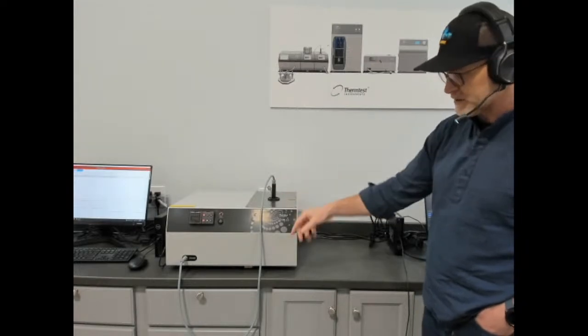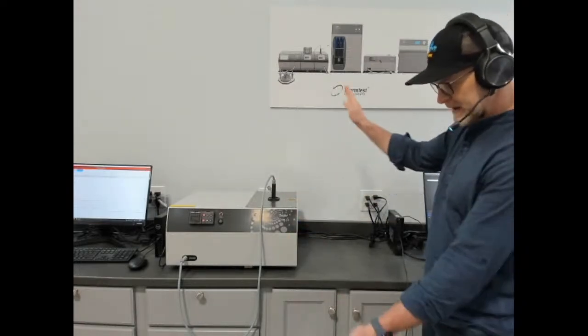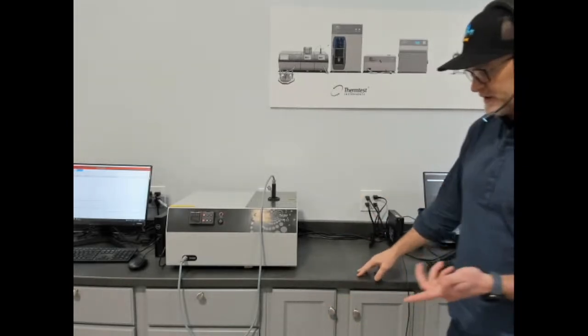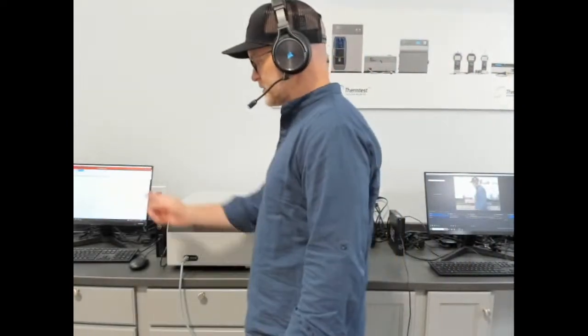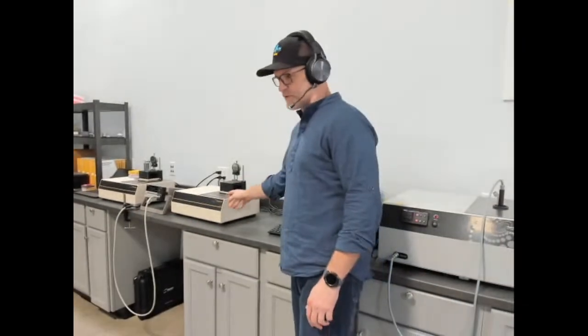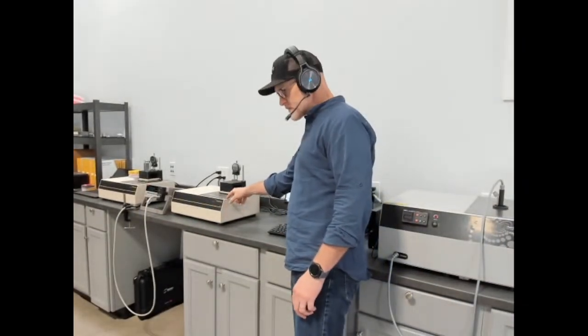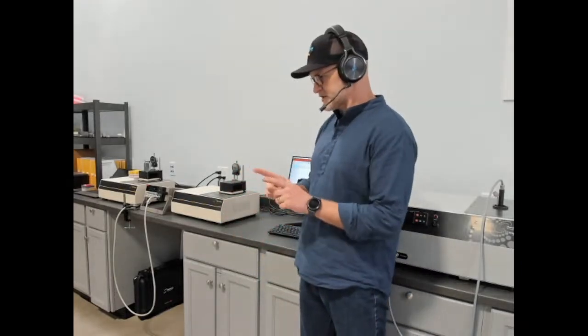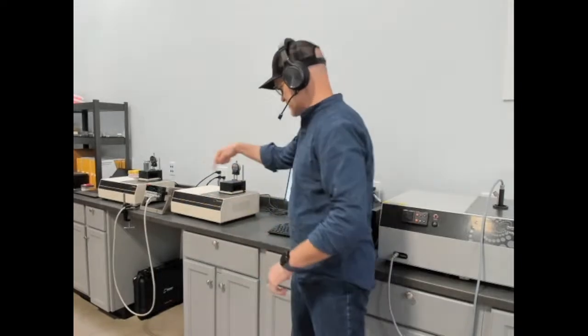As it sits here, this can go from 10 to 200 C. We can expand those ranges from cryogenic up to 300 C, depending on your application. Our baby brother to the heat flow meter is our small format insulation instrument. So this is for measuring insulation. Sample size is as small as 2-inch, as large as 12-inch square.